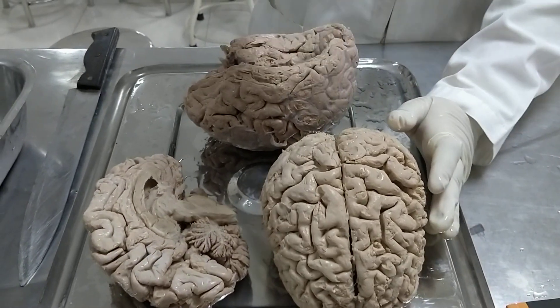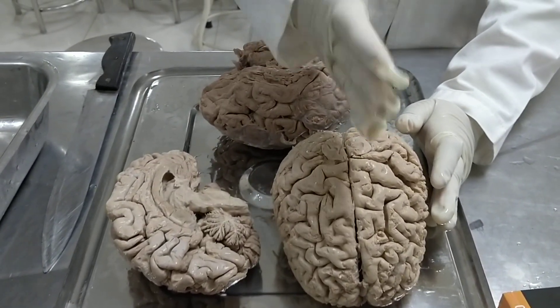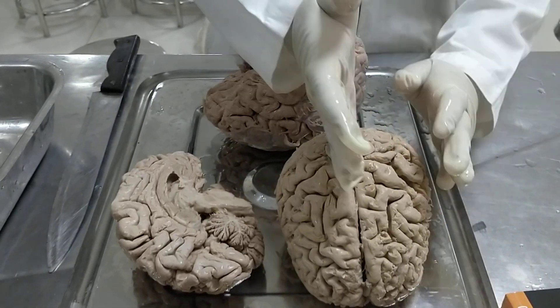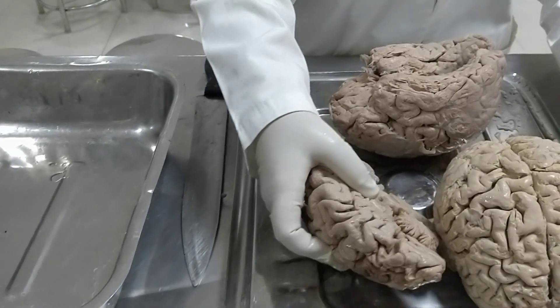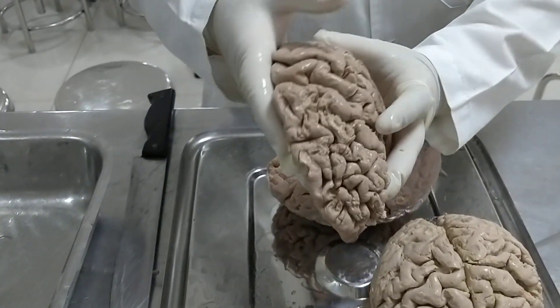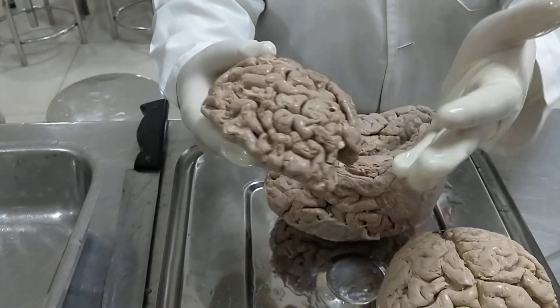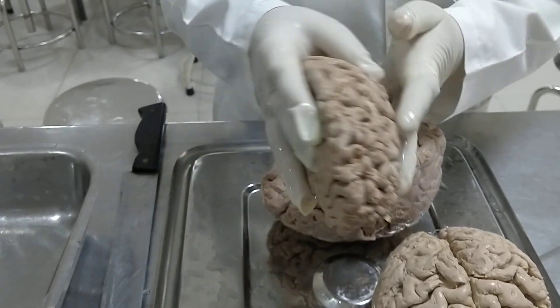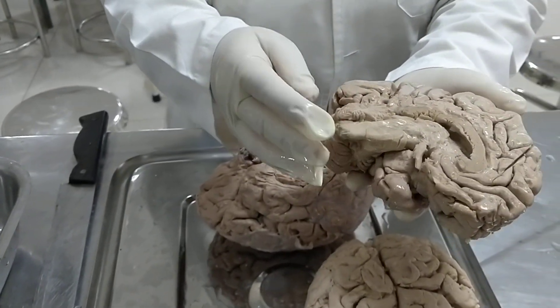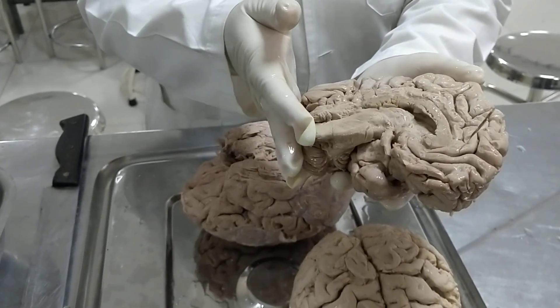The first section which we usually cut is a sagittal section, where we divide the brain into two equal halves. We have already cut the sagittal section. You have to see the anterior end and the posterior end. If the brainstem is attached, it is very easy to remember, because the cerebellum is at the hind end or the posterior end.